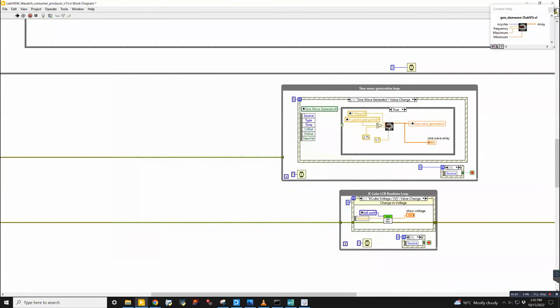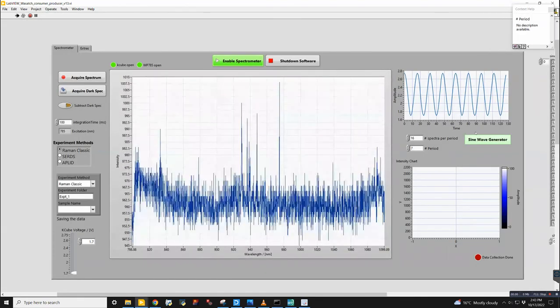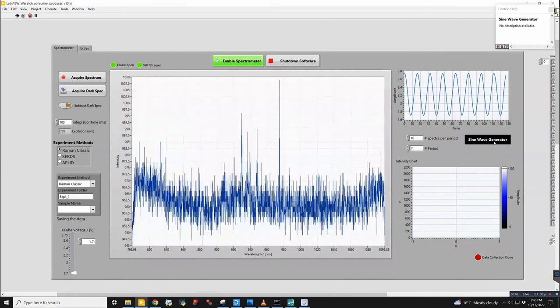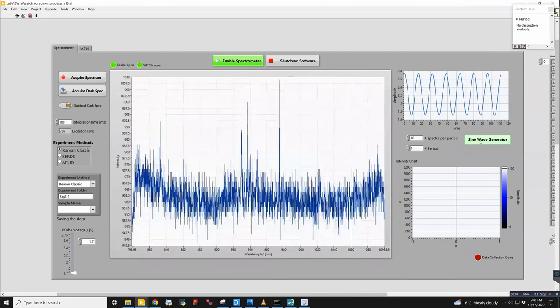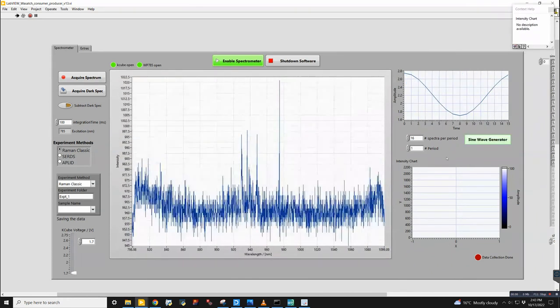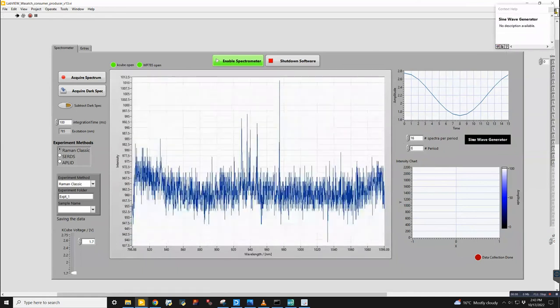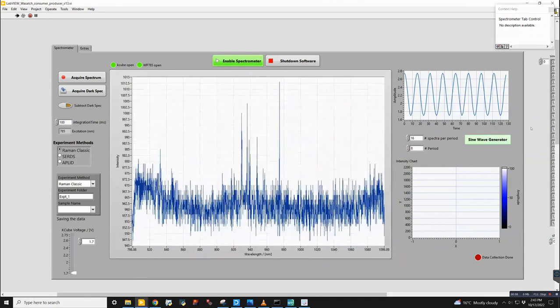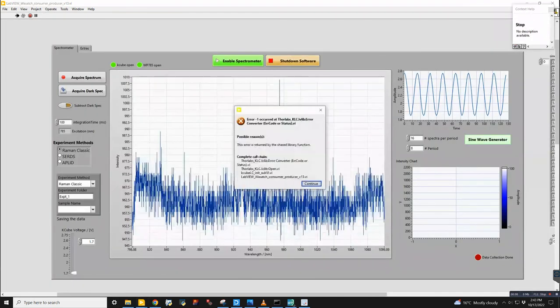So I'm going to stop running this. Anytime I make a change and I click this button, it will change that. So if I just want one of these, then it will do that. But I will go back to 8 because we like powers of 2 here. And then I'll stop the program.